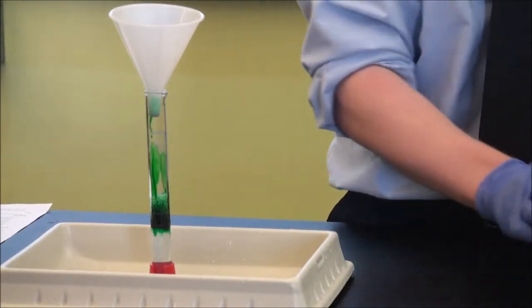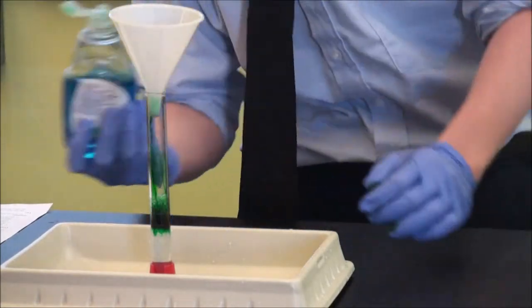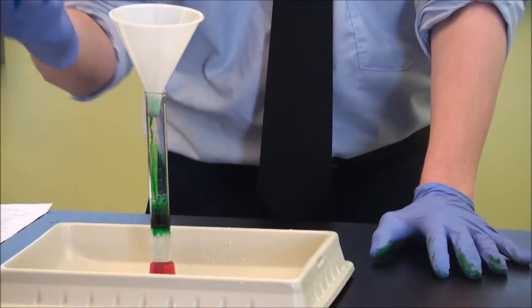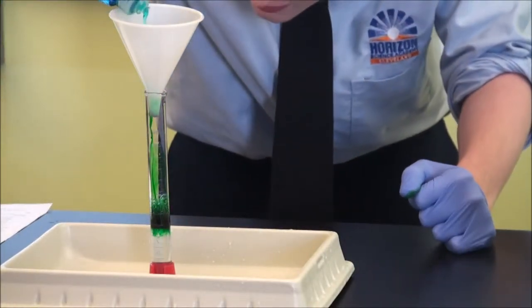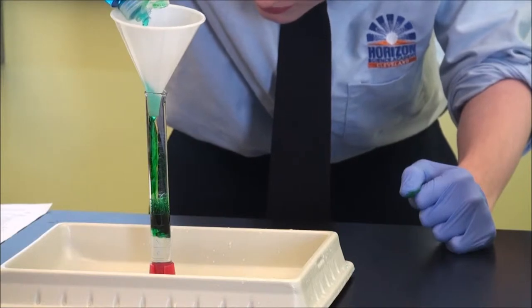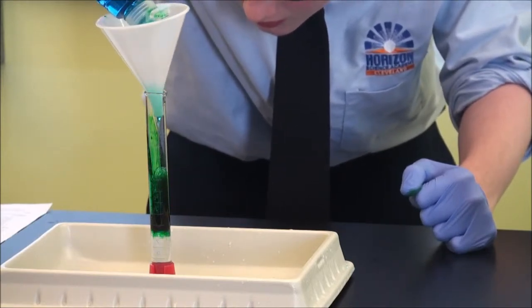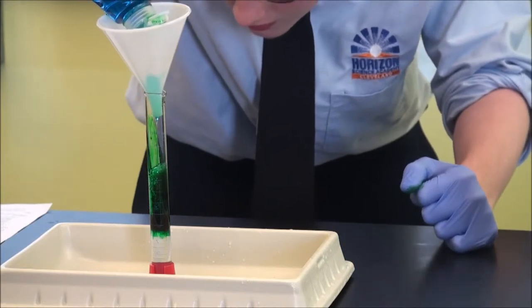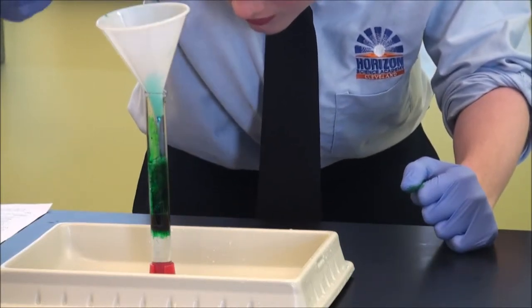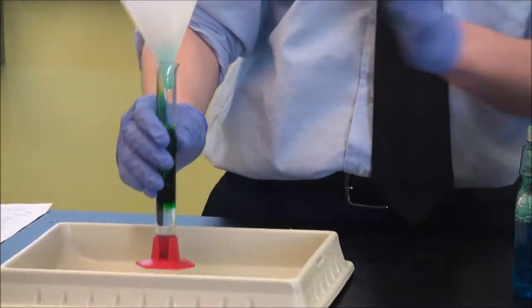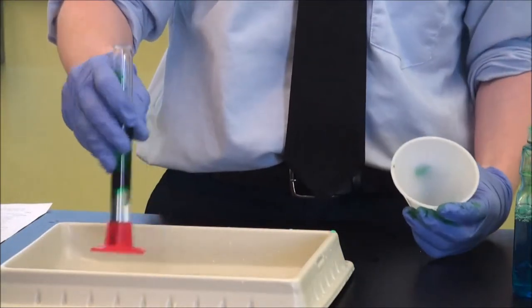We add dish soap, about 5 milliliters of that, and then you shake it up to mix it.